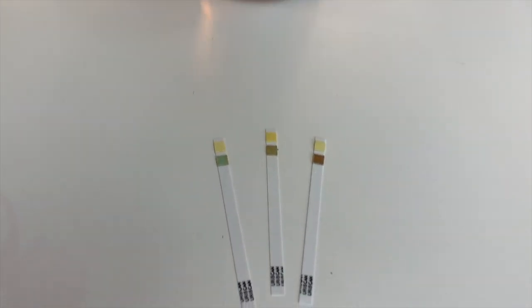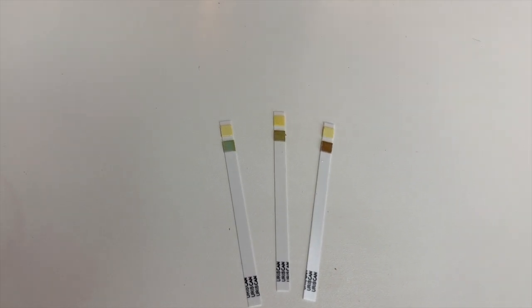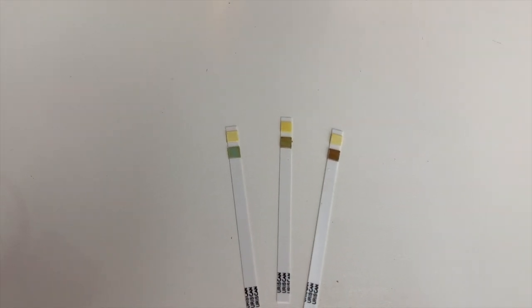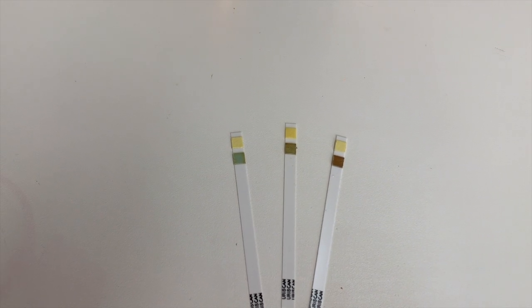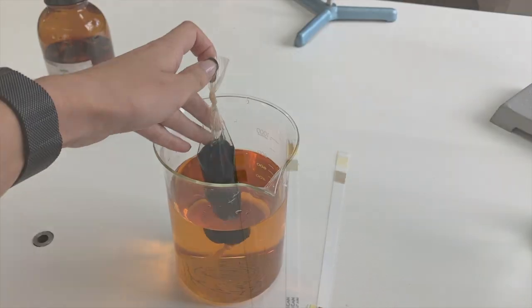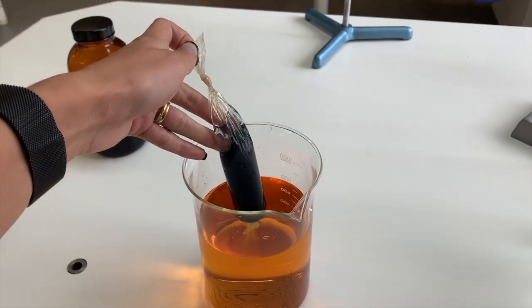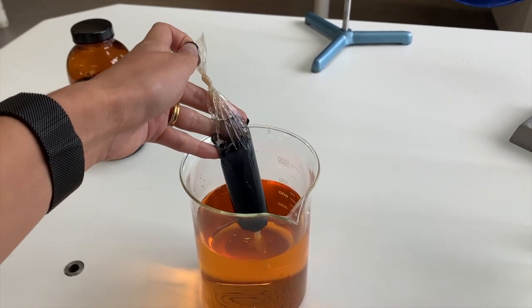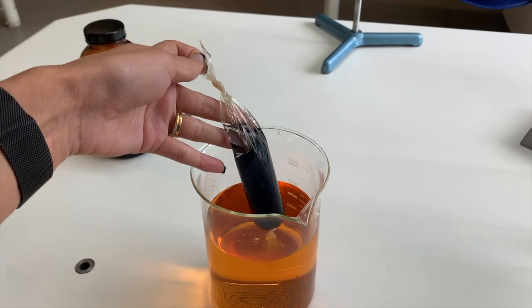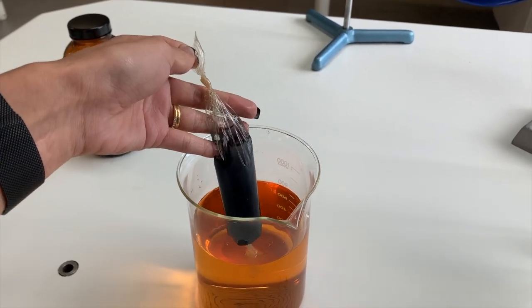So the presence of glucose outside the beaker in the iodine and water solution indicates to us that the glucose has moved from inside the dialysis tubing through the semi-permeable membrane into the beaker. The colour change within the dialysis tubing is also evidence to us that diffusion has occurred, as iodine has diffused through into the dialysis tubing, with amylose present in starch changing to this dark blue colour in the presence of iodine.